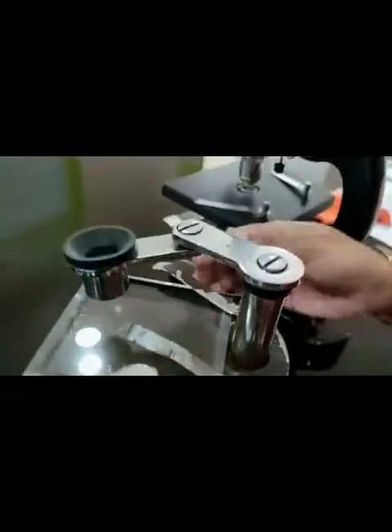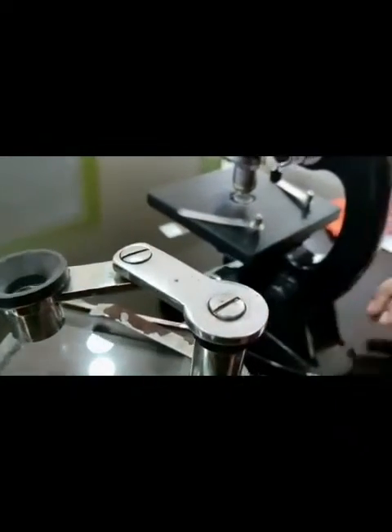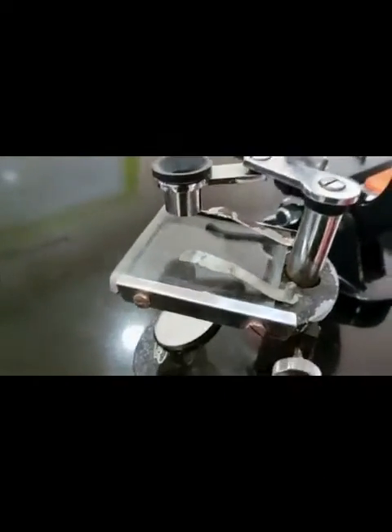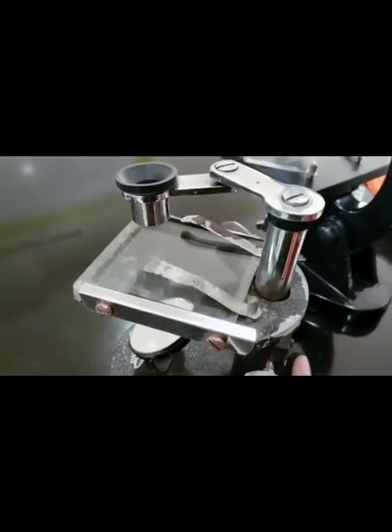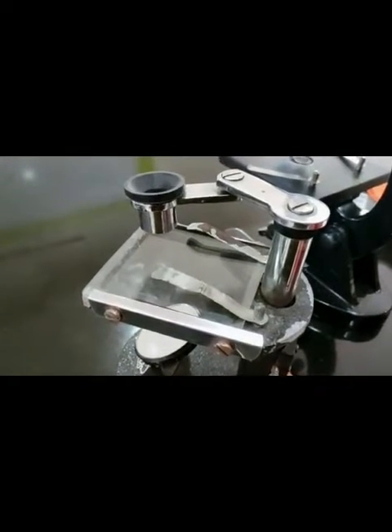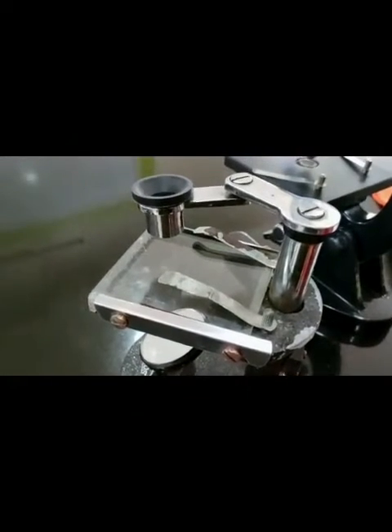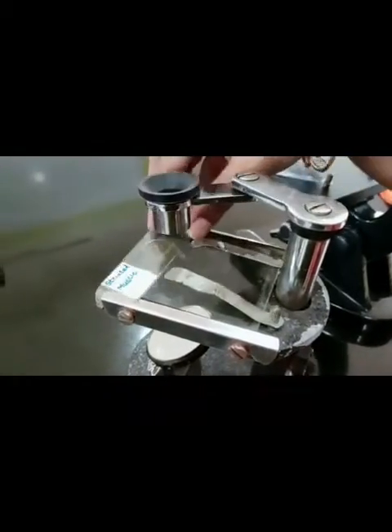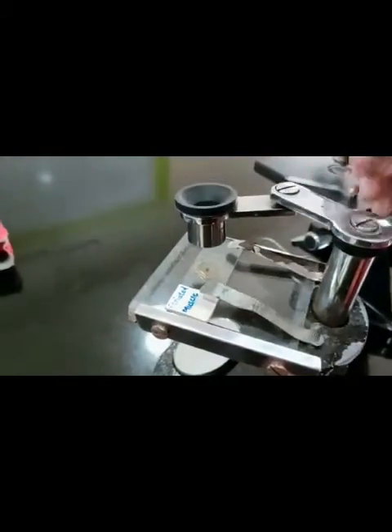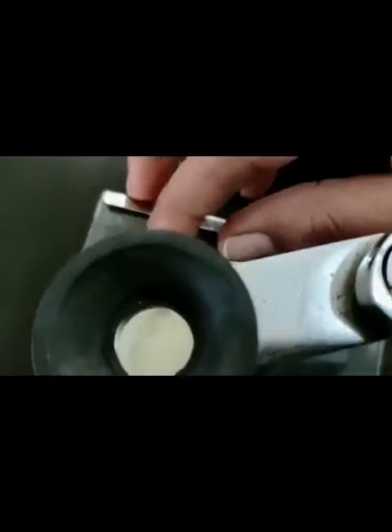These are the clips. When we want to observe any dissected part of a flower, cockroach, or any insect, we just keep that prepared slide on the stage, and this simple microscope magnifies the object. That is why it is called the simple or dissecting microscope.